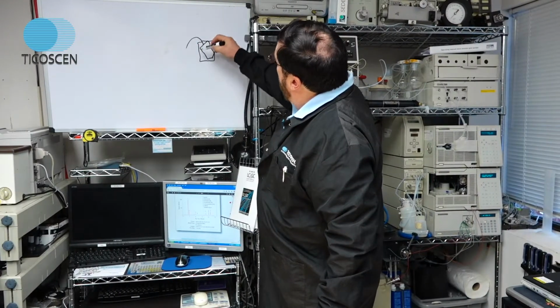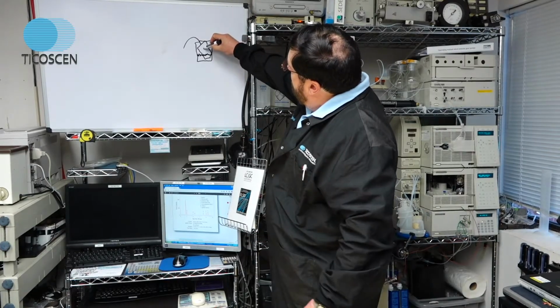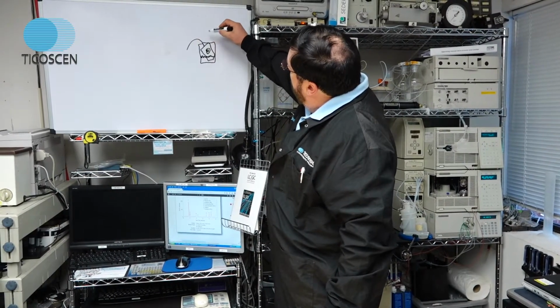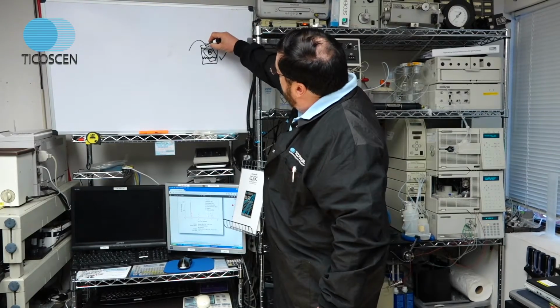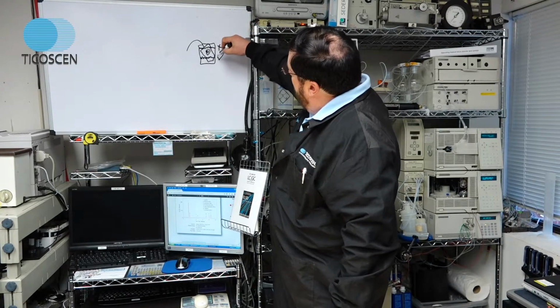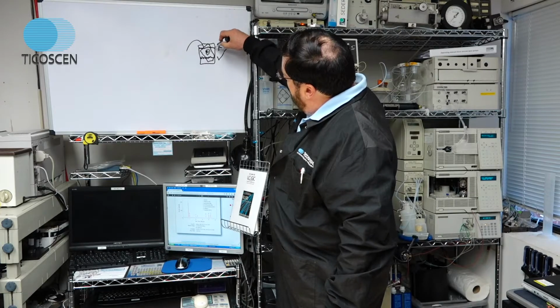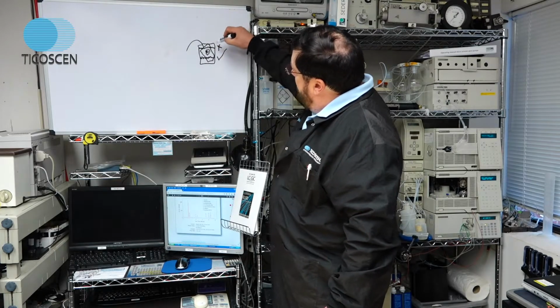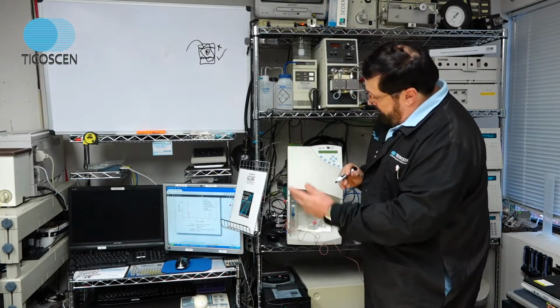The line comes out, and you only fill it up like that. This is the side view of the nebulizer, and this is what you want, a solvent level there. If you fill the solvent beaker up this high and submerge it completely, bad. You want about 1 inch. This is good. Too high is bad. Low is good. That's how you sonicate your nebulizer and reinstall it back in the detector.